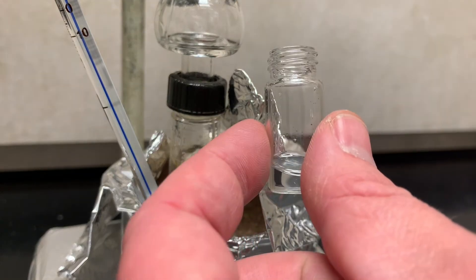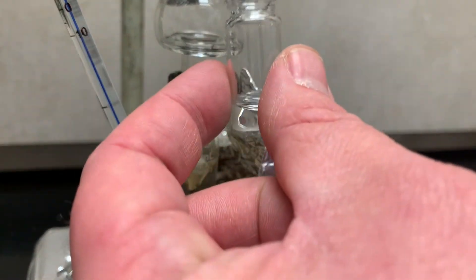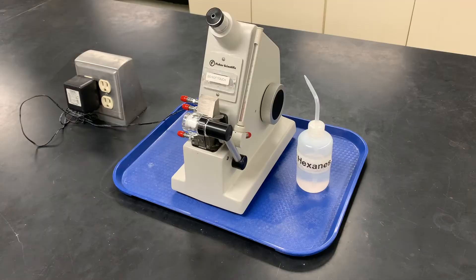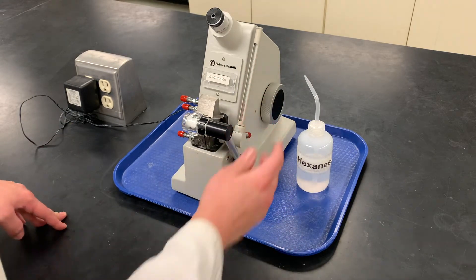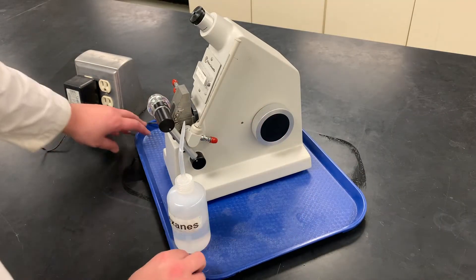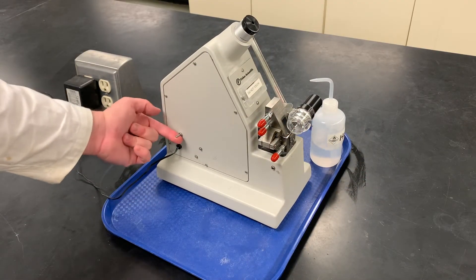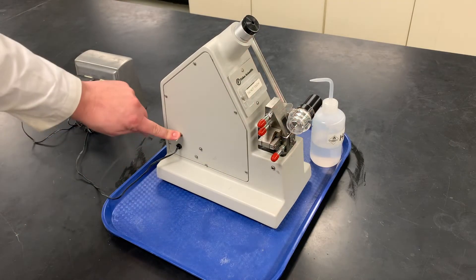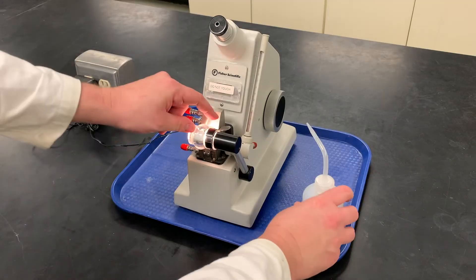Get whatever little bit is left over at the end — there's always just a little bit more. Now, for the refractometer: there are a few components. There's a thermometer here — temperature is important. On the right is the knob that controls the position inside. On the left is a switch: up is off (that's where you leave it when done), the middle is outer light on, and holding it down activates the inner light.